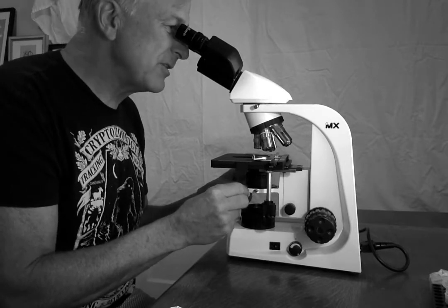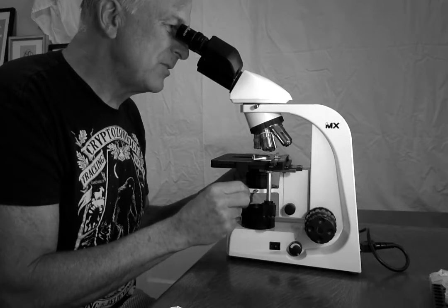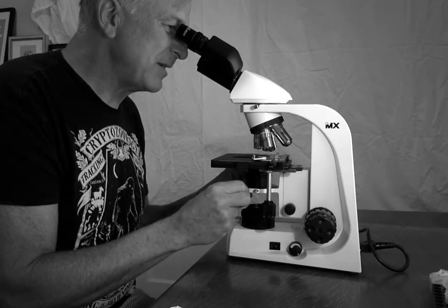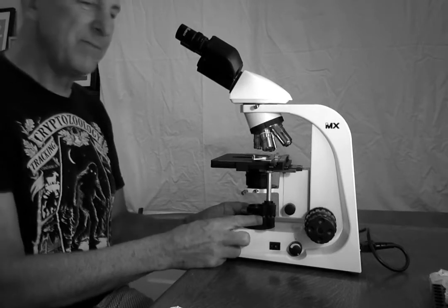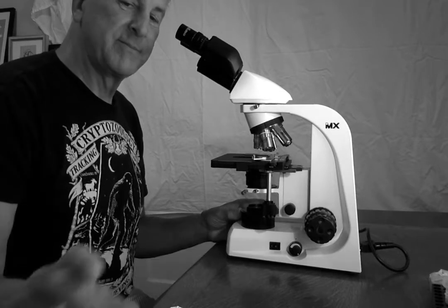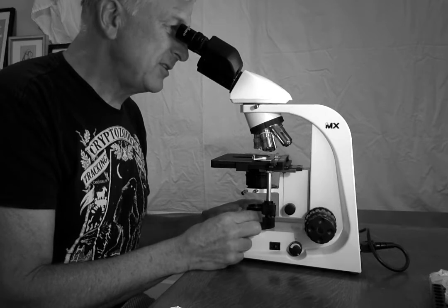And if I play with those a little, I can see my little dot of light, my little polygon of light, moving around, and I'm guessing where the center is of my field of view. And I think I'm about there, but I can't tell for sure. So the next step is to open the field diaphragm till the light fills about 90%, maybe 80% of my field of view.